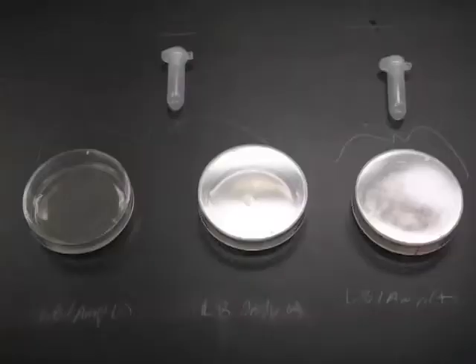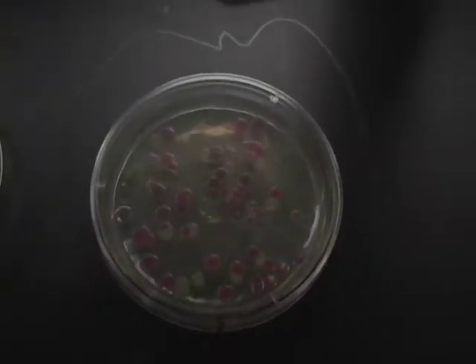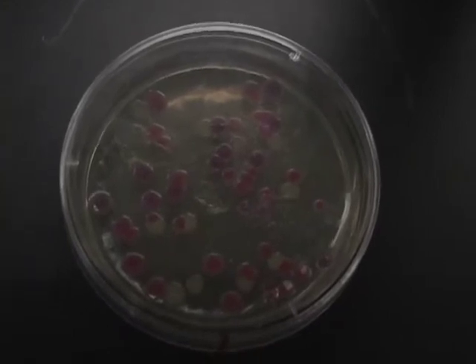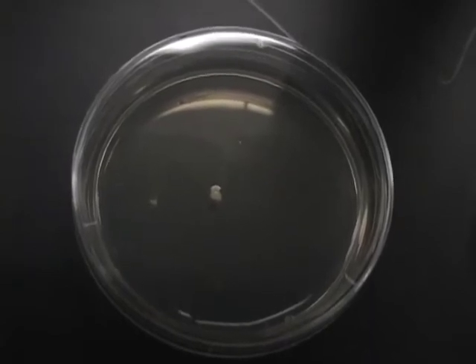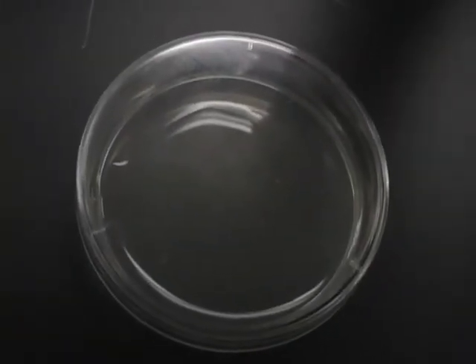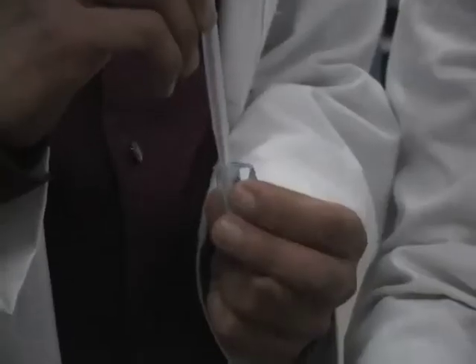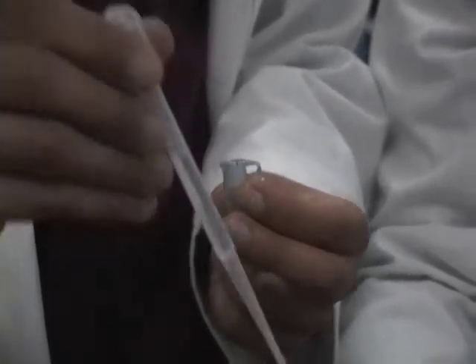Now we can add our transformed and untransformed bacteria onto our plates with and without our ampicillin. What should we expect? We have three plates. This plate had the fluorescent protein gene and ampicillin resistance, so it should glow. The other plate with only LB and no ampicillin will have bacteria growing on it, but it's not going to glow — because we didn't add a plasmid to the bacteria with the fluorescent protein gene. Finally, the last plate had bacteria without the ampicillin resistance gene, so it's going to die, because it didn't have the plasmid with the ampicillin resistance.